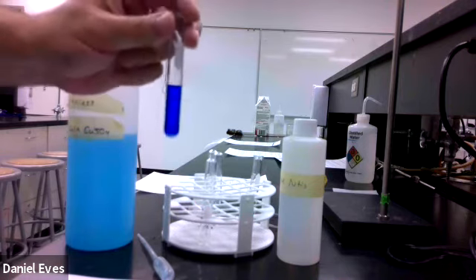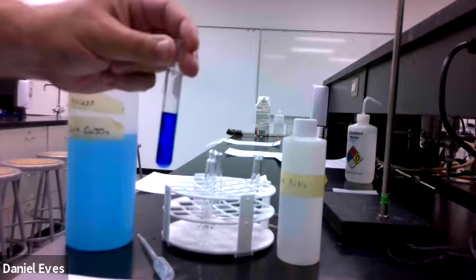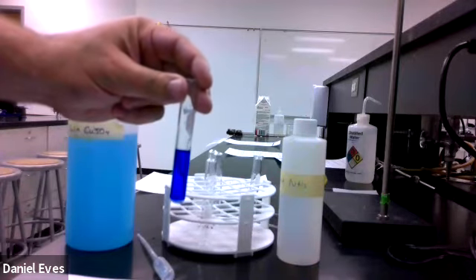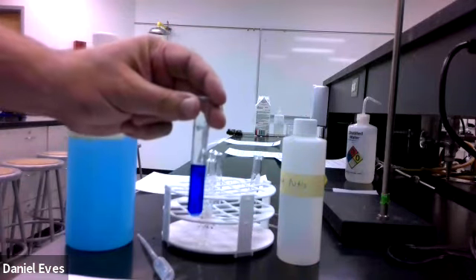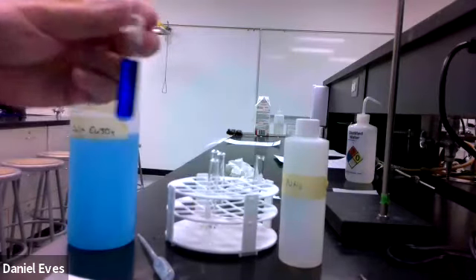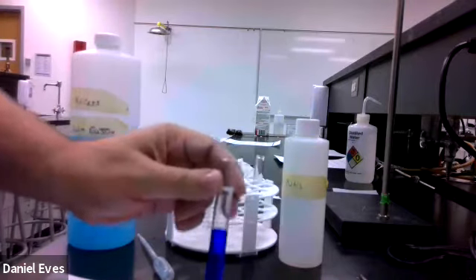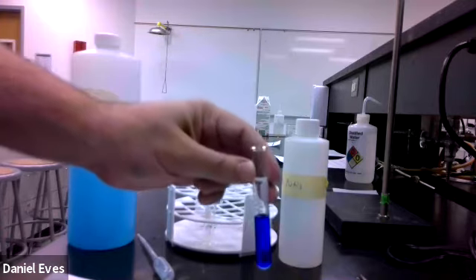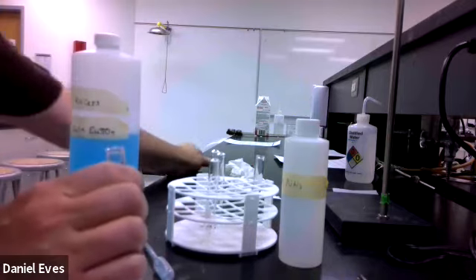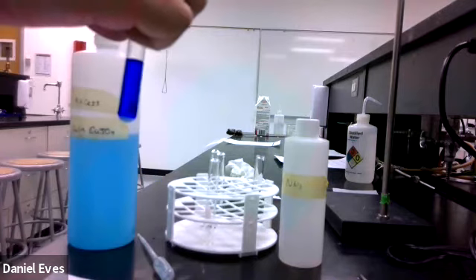So the next thing that we want to do is figure out what would happen if we add acid to this, because it's going to make it go back the other way. We're going to have the equilibrium shift when we add a stress to it. So we have this, and we should be able to figure out the equations of what's going to happen. So if we add acid to a hydroxide, it should go to water. And if we add acid to ammonia, it should go to ammonium. It should make that. So we're going to go ahead and take a little bit of hydrochloric acid. We're going to add it to the ammonia.